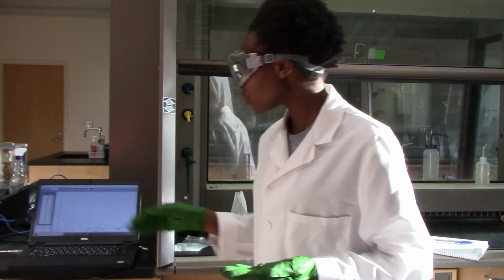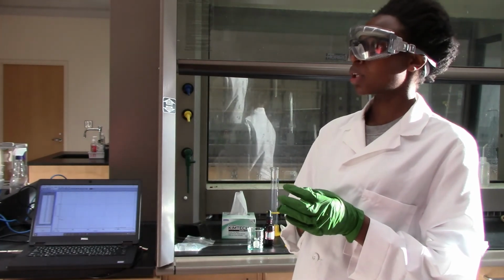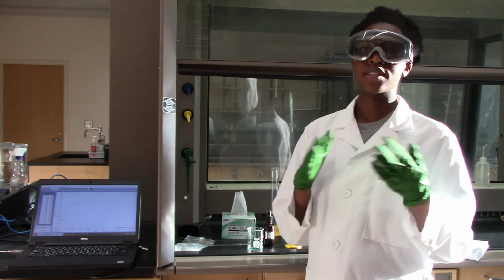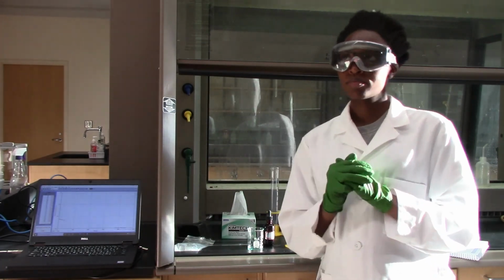And so for this run, I'll just wait until I see an absorbance value of below 0.05, then I can stop the run, and that's how I have my data. And then I'll do the same thing for runs 2 and 3, but with a lower concentration of bleach. And that's it.